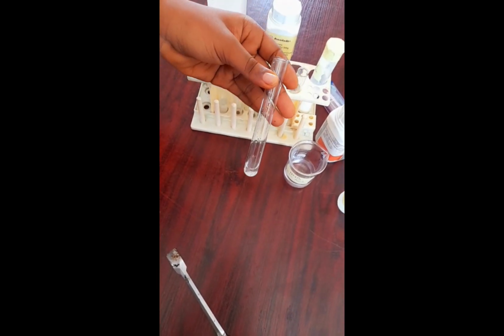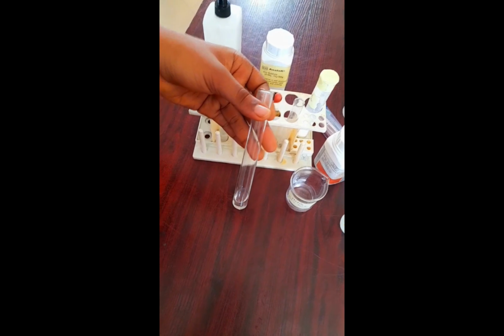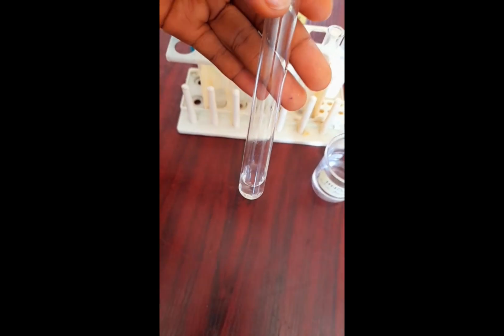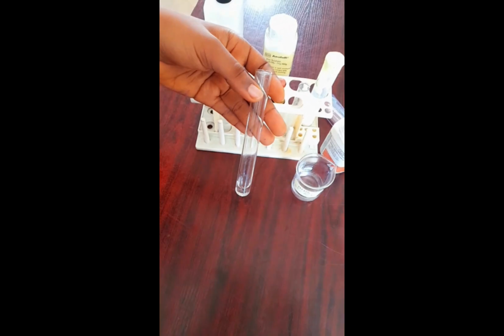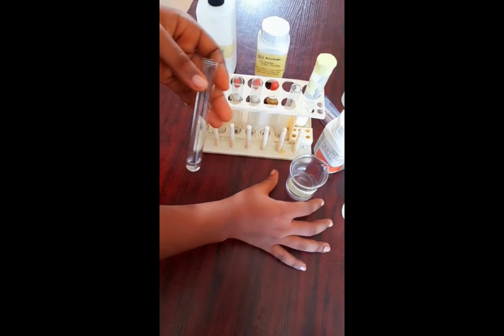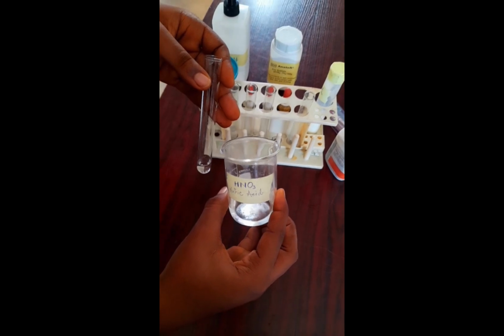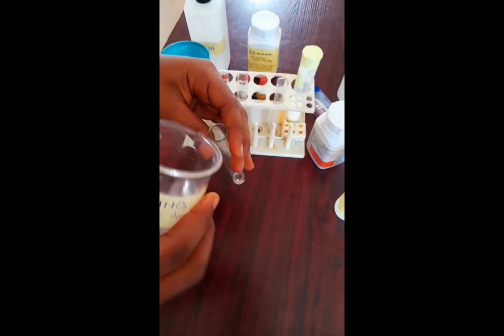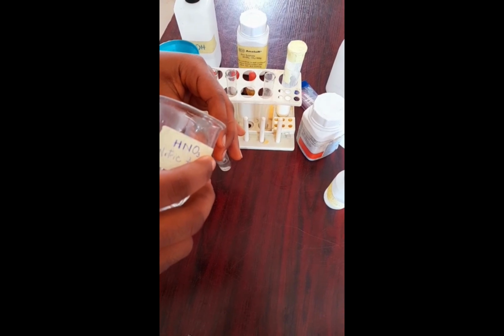Now C, from our own view, could contain chloride ions, and it could be any salt that contains chloride. So you just put the C in water and stir. And to the first portion, remember, we are asked to add dilute HNO3. So we add dilute HNO3 to it.